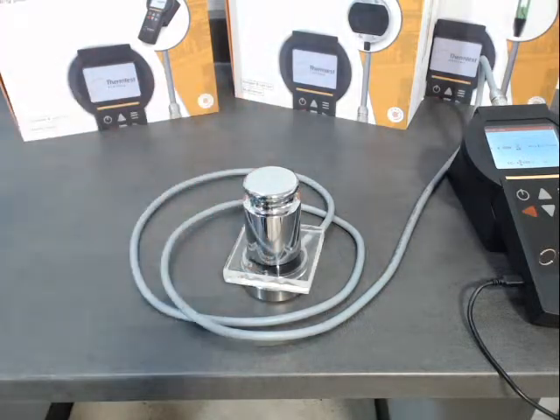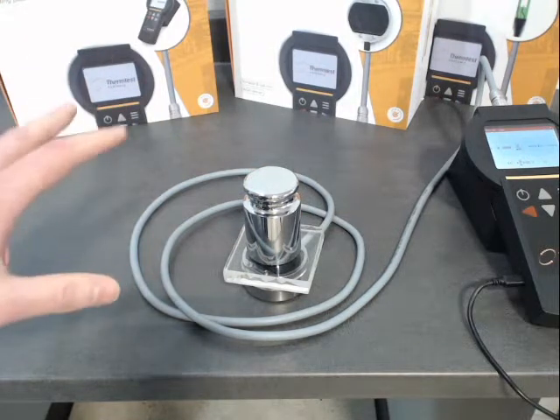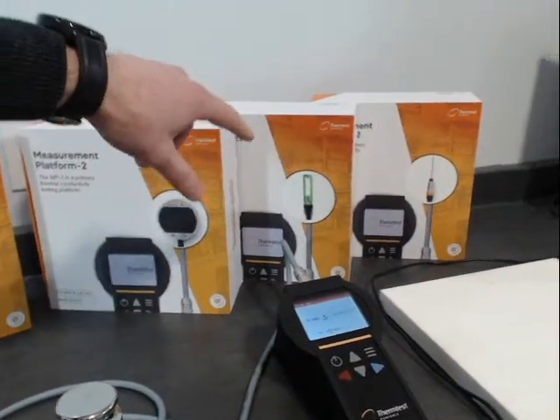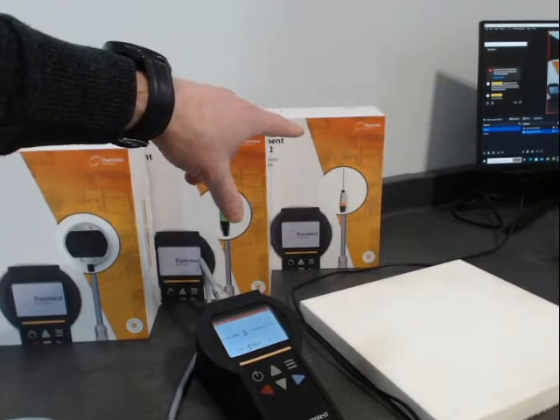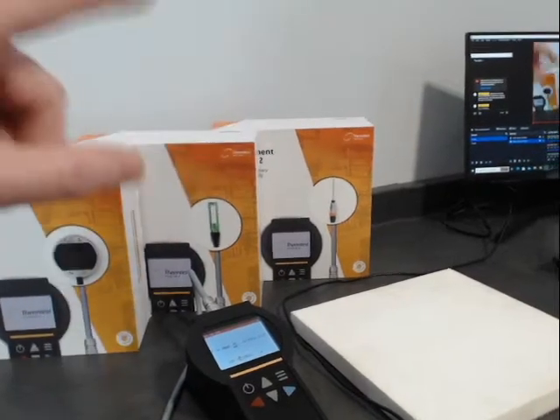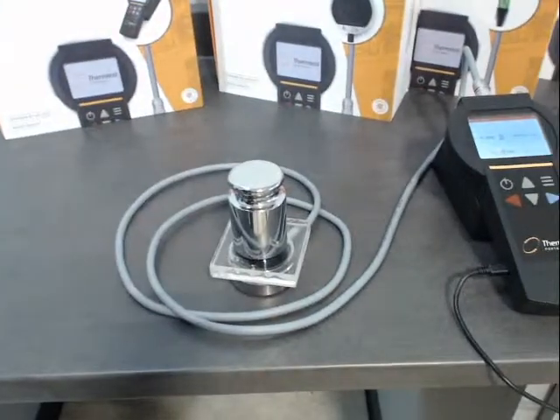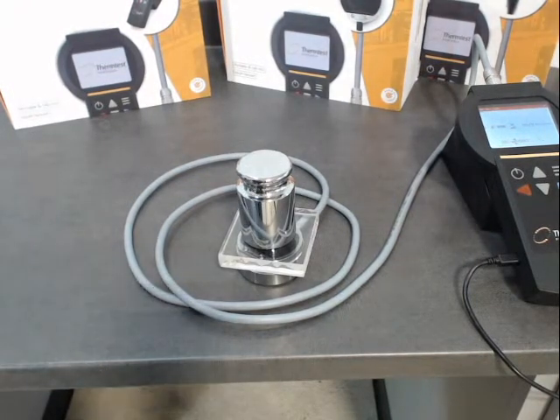This is absolute — this particular sensor follows all the ideal theory for transient plane source, so it's not calibrated, it's absolute. And that's actually the same for all of these sensors. Transient hotwire is absolute, and the new version of the ASTM for the 100 mm sensor is absolute — ASTM D5334-22 is absolute. So we can now say that these are all absolute, meaning from the output of the raw data, the thermal conductivity is calculated.